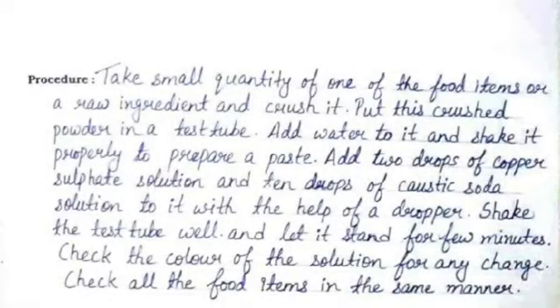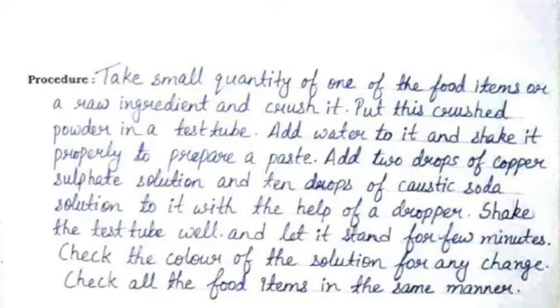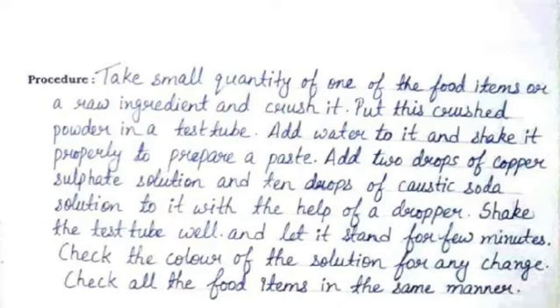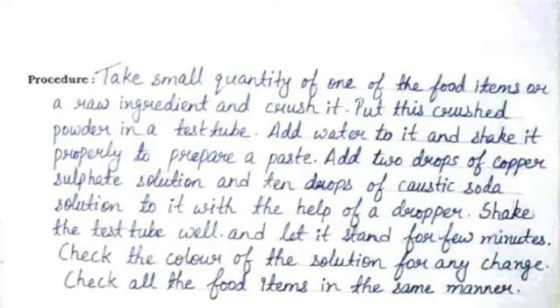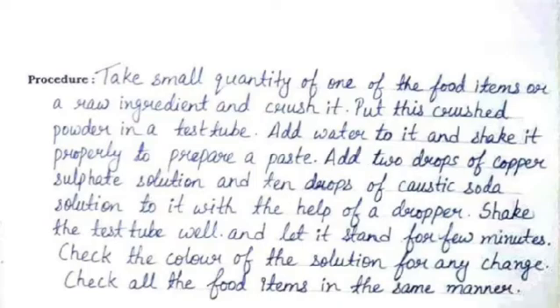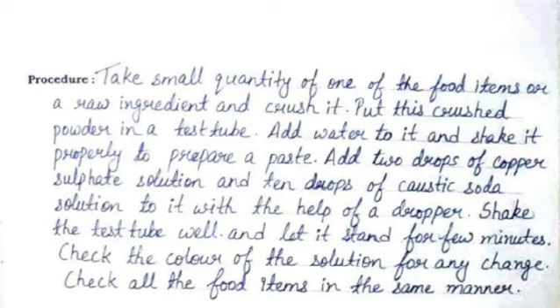The procedure is: take a small quantity of one of the food items or a raw ingredient and crush it. Put this crushed powder in a test tube, add water to it, and shake it properly to prepare a paste. Add two drops of copper sulphate solution and 10 drops of caustic soda solution to it with the help of a dropper. Shake the test tube well and let it stand for a few minutes.